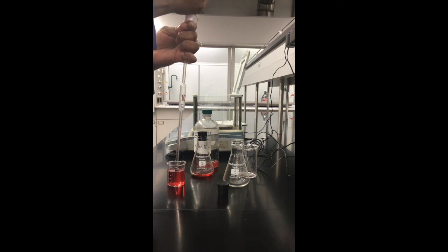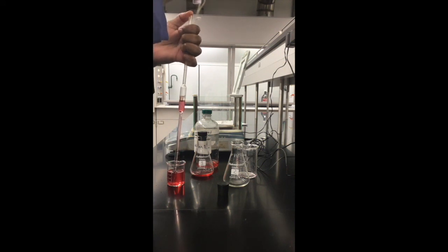Alright, trial 2. We didn't get it right, okay? We repeat it until we have the meniscus just by the calibration mark.